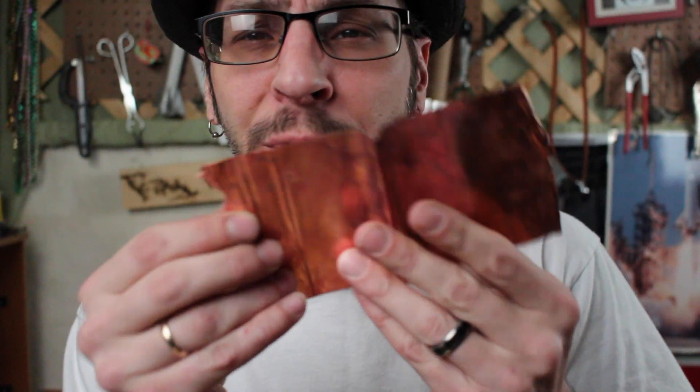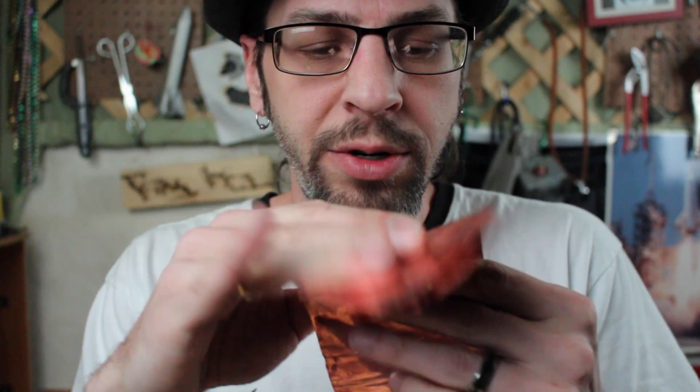So we've got to try this again, and we're going to go all out. I've gotten a piece of copper foil that I've folded into a smaller bit here — actually a big sheet of copper foil. We're going to fold that down a little bit just to even up the size ever so slightly. I think we could probably do this reaction using this big piece of copper, and if the previous ones haven't been impressive enough, this is going to be just like staring at a campfire.